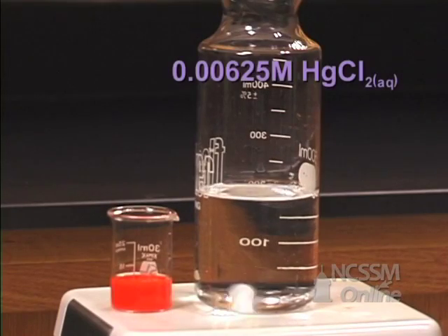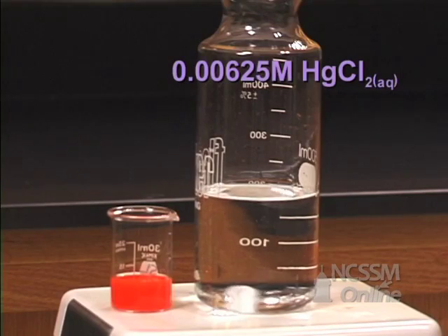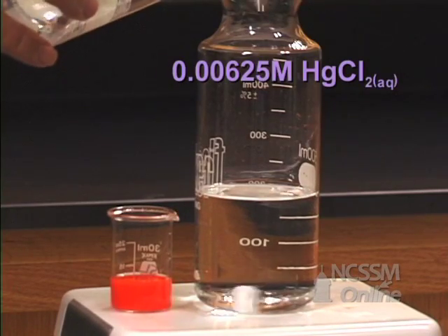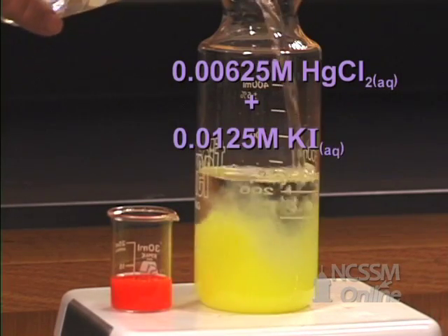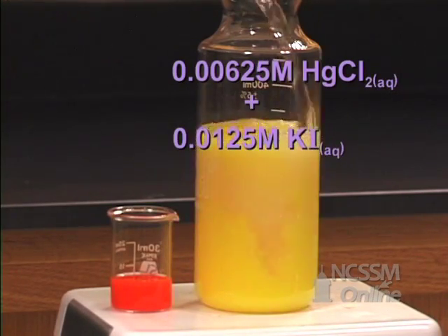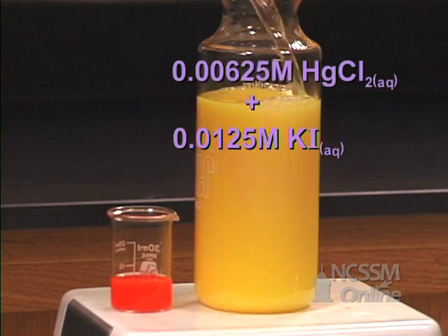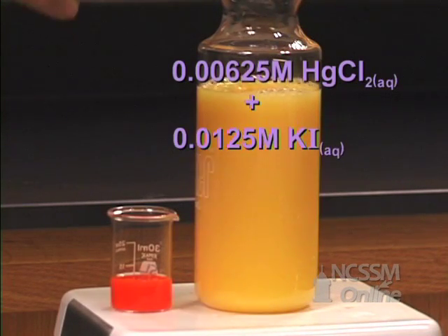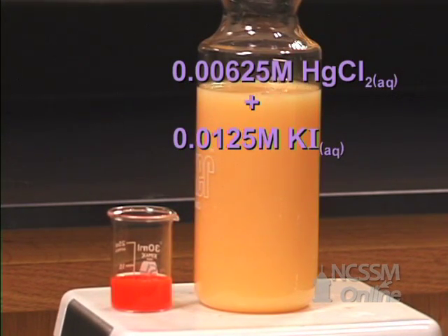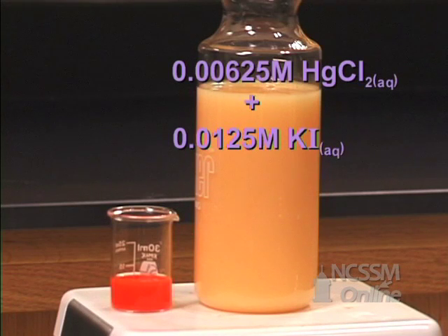We will now mix dilute solutions of mercury chloride and potassium iodide. We see the formation of a yellow solid. This is the product of kinetic control — it is not the more stable product.